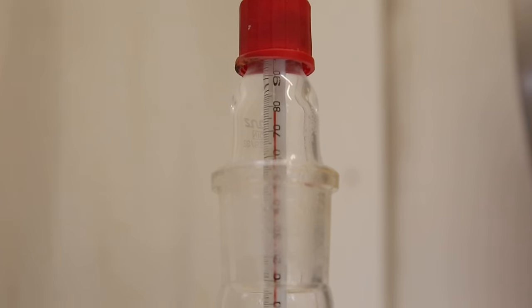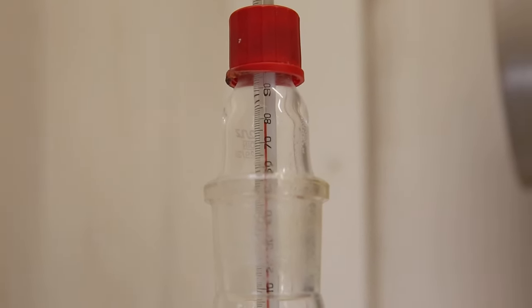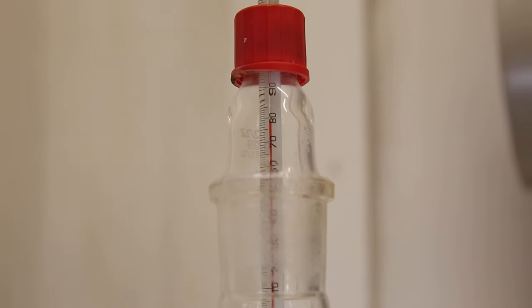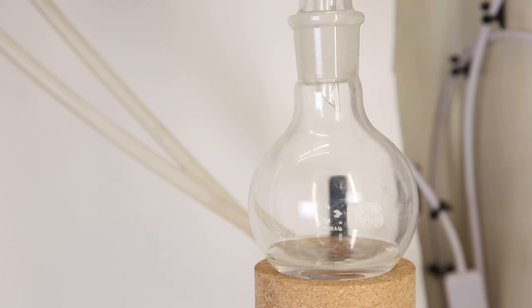When we take a close look at the column, we can see the line of condensation slowly move upward. When it reached the condenser, the thermometer read 80°C, and quite some liquid came over. The temperature didn't stabilize at this point before, so it is possible that it was heated too quickly during the first distillation. 80°C should be the boiling point of benzene and cyclohexane, though benzene is less than 1% of the total gasoline, so it is probably mostly cyclohexane.